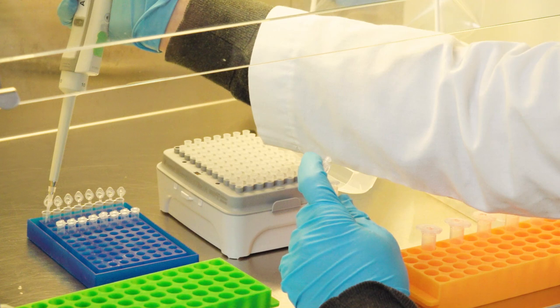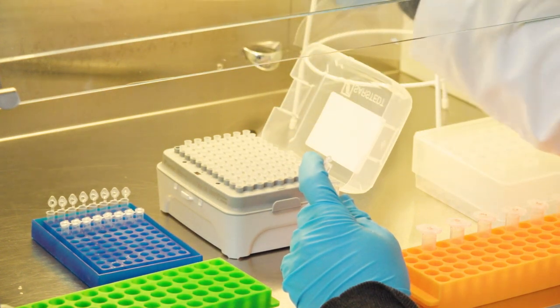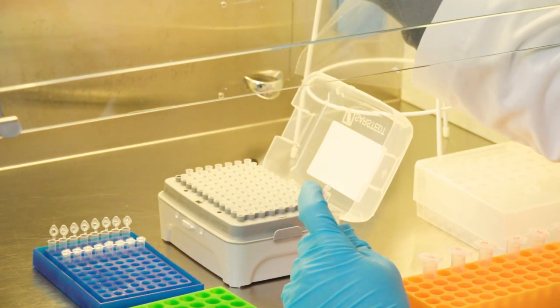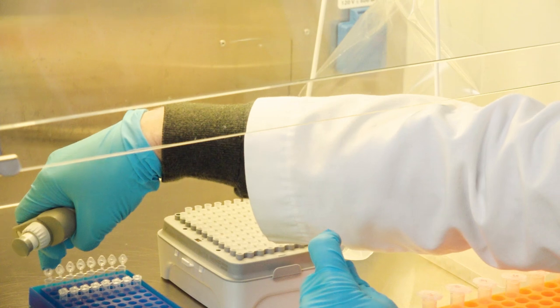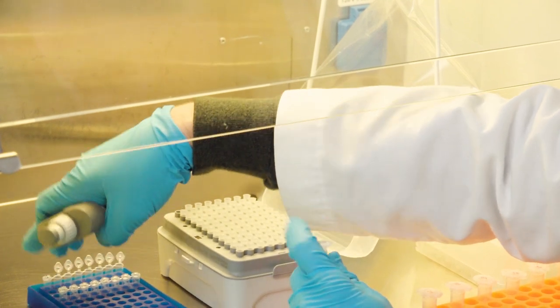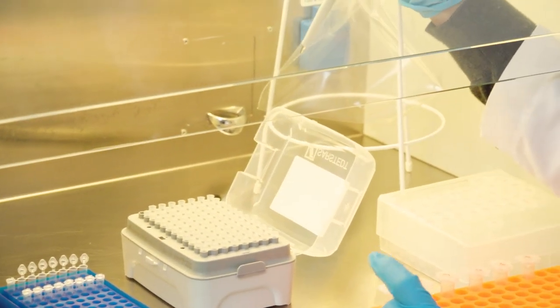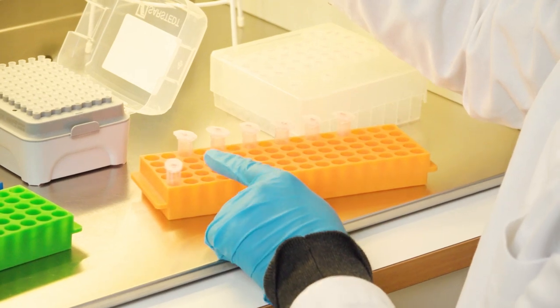Then I pipet into the tube, and here I get rid of the tip right away, and close it down. And then I also move the sample down to the last row.